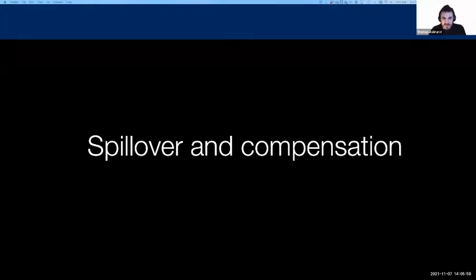What we're going to try and tackle today principally is looking at how to look at our flow cytometry data after we've performed things like compensation or unmixing, how to assess how well that's gone, and if necessary, how to adjust our compensation results in a way that is kind of methodical and robust, which is important.